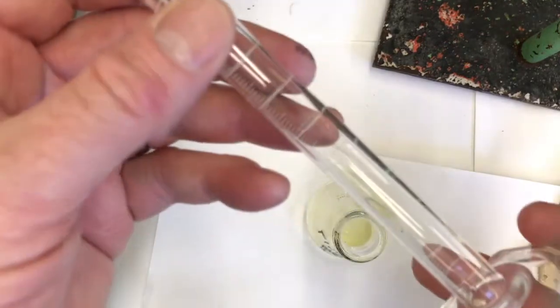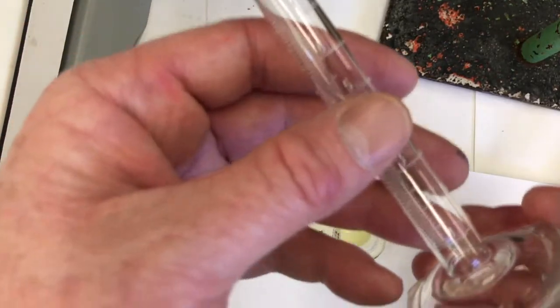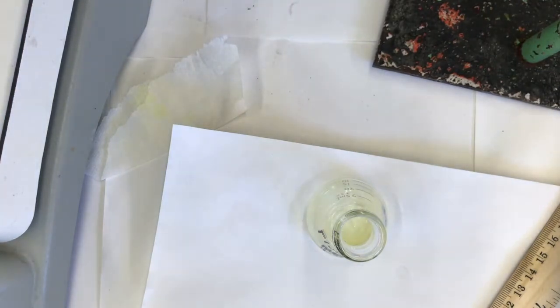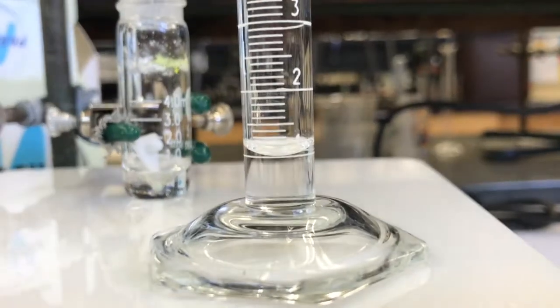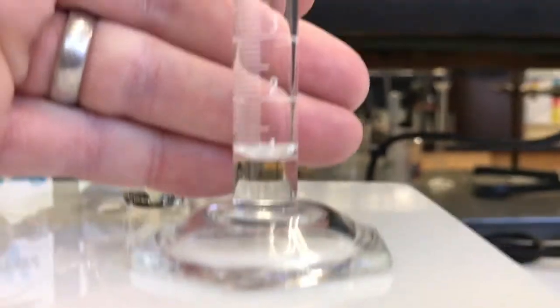Now I'm going to add 1 milliliter of deionized water to my reaction. I got a 10 milliliter graduated cylinder, so I'll fill the meniscus up to the 1 milliliter mark. Do my best here. Let's see, almost. I think that's pretty good. Let's see if you agree. Does that look to be about 1 milliliter? It's hard to read. That's the one, yeah, that's about 1 milliliter.